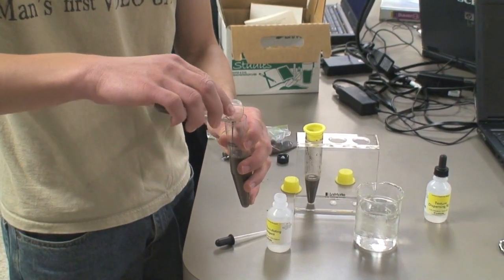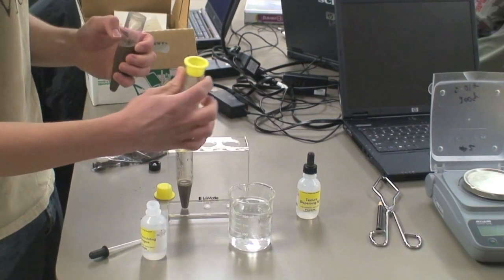Pour the solution from the second tube into the last tube, and return the second tube to the rack.